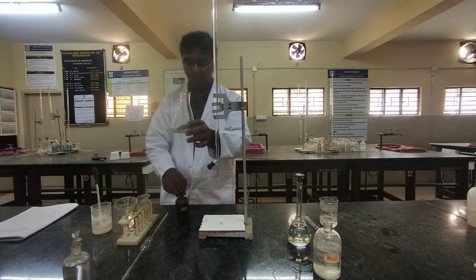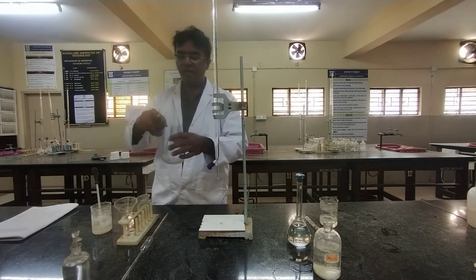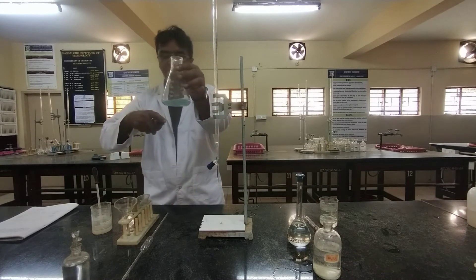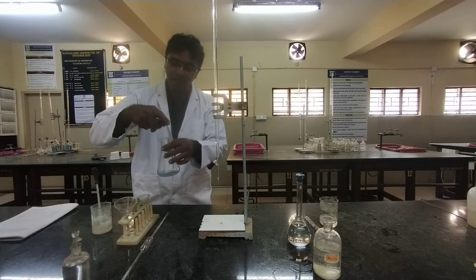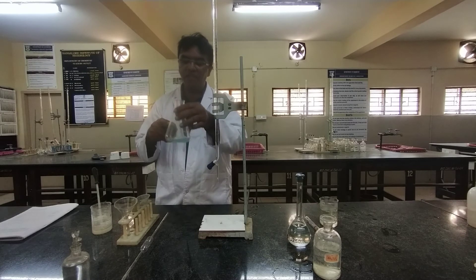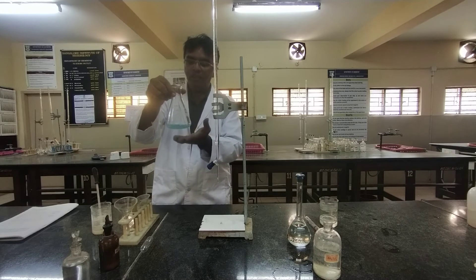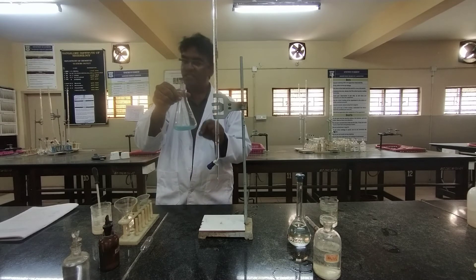After pipetting out 25 ml of the brass solution, add ammonia drop by drop until you get a blue precipitate. The formation of the blue precipitate indicates that all the nitric acid has been neutralized, because ammonia first neutralizes the nitric acid, and once all the acid is neutralized, the next drops of ammonia react with the copper ions to form cuprammonium ions, whose color is blue.